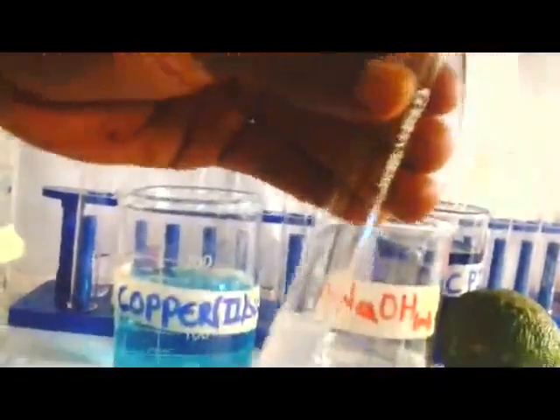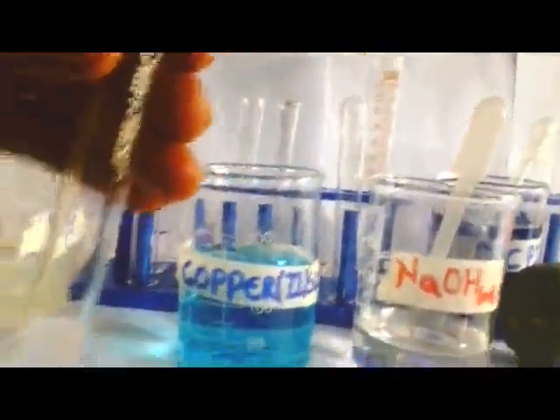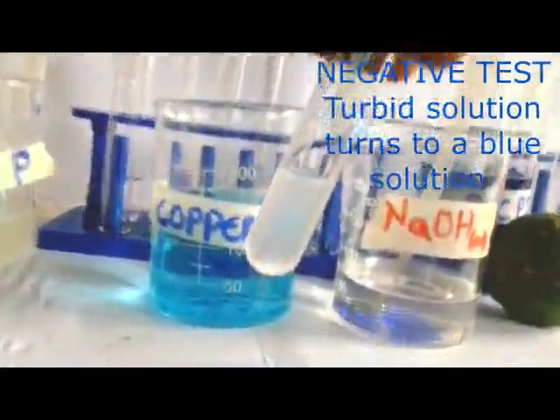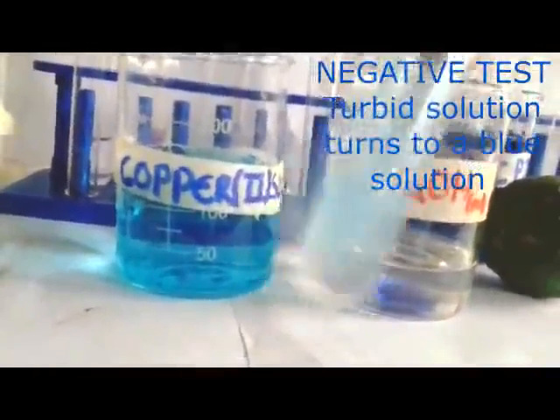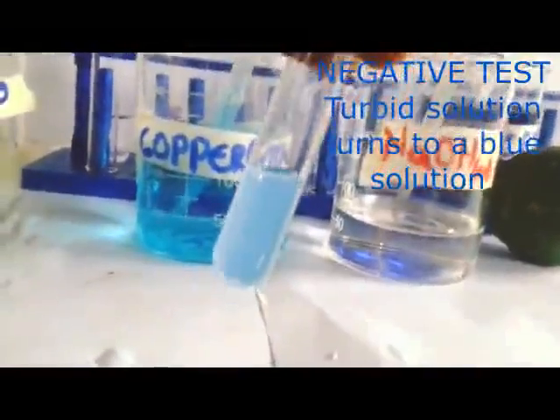Put sodium hydroxide. Then what are we going to add? Guess it. We are going to add copper 2 sulfate. Now I get my copper 2 sulfate. I put some drops. 1, 2, 3, 4. Let me do the shaking. Now members, try to be observant.